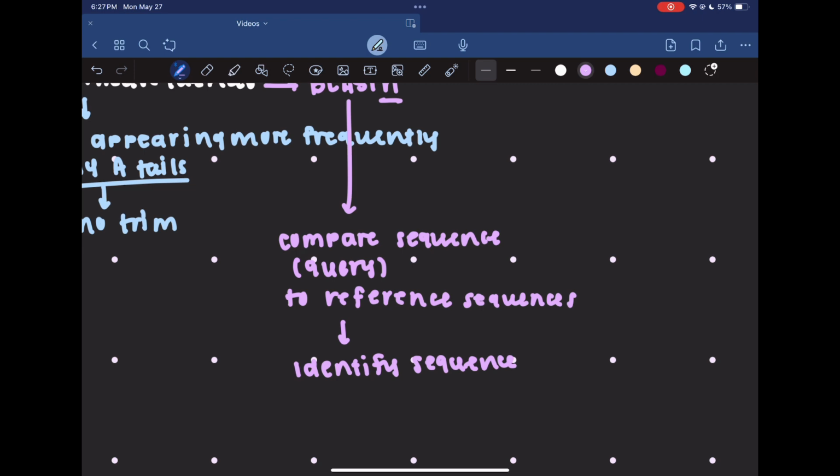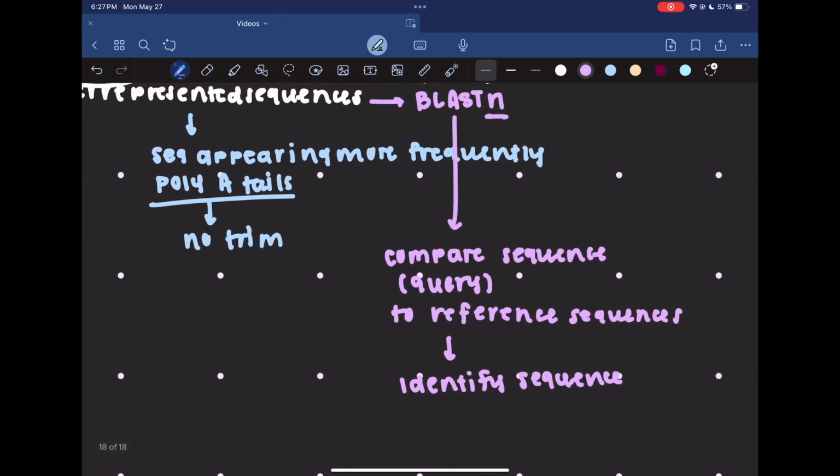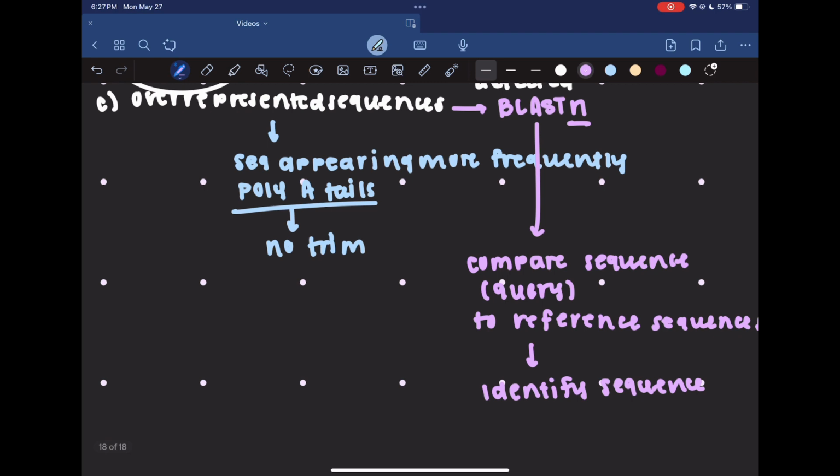Sometimes it can be contaminants, which is why it's always good to blast your sequences. For me, I had one overrepresented sequence that I performed BLAST on. Again, I'll link where you can find the website where you can perform BLAST. And I compared it against a reference genome for my organism that I was using, and I found that it was just a really common insect gene that was actually popping up in many different insects very repetitively. So just a highly conserved gene that's transcribed a lot, so not a big problem. But you might have cases where you have contaminants in your sample or something similar where you blast that sequence and you're not finding it, and then that might be a time to investigate further.